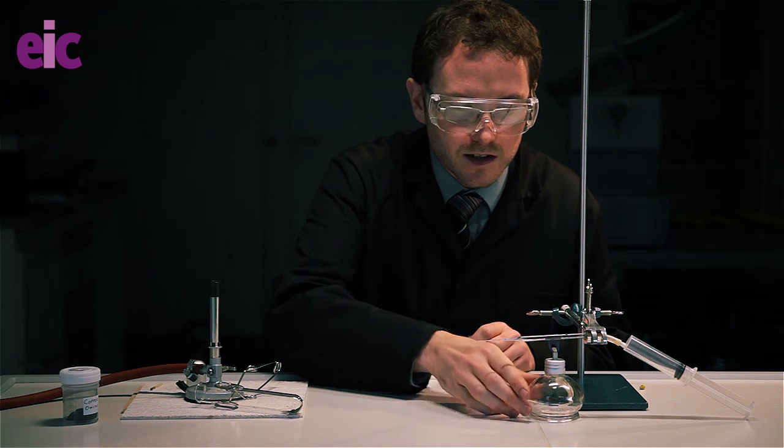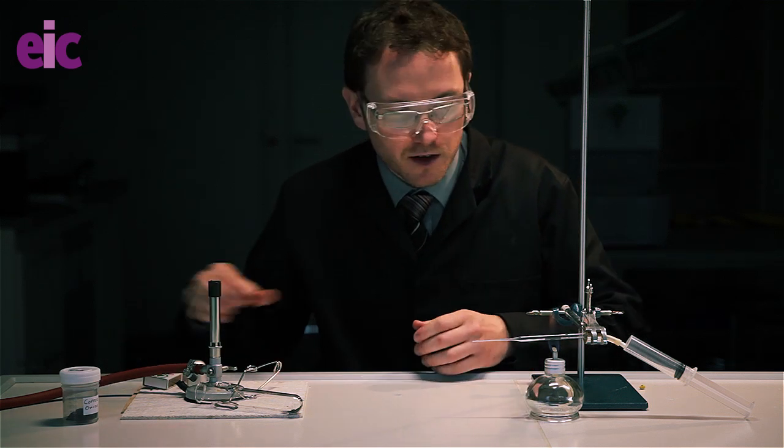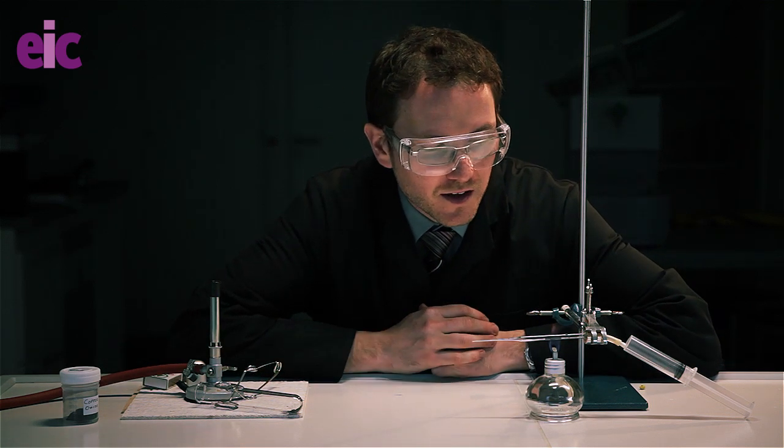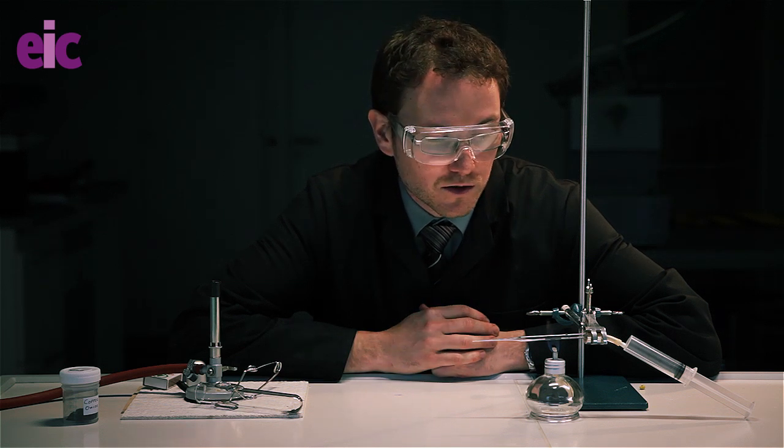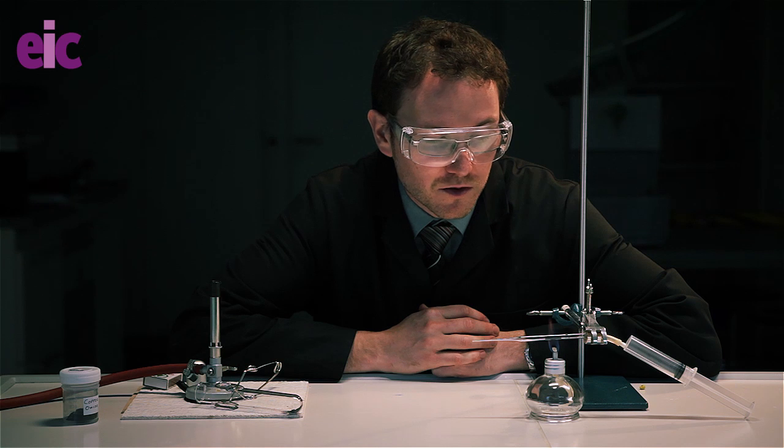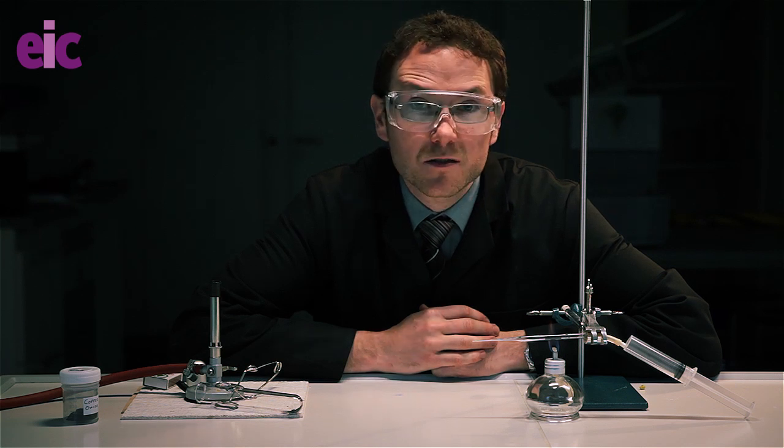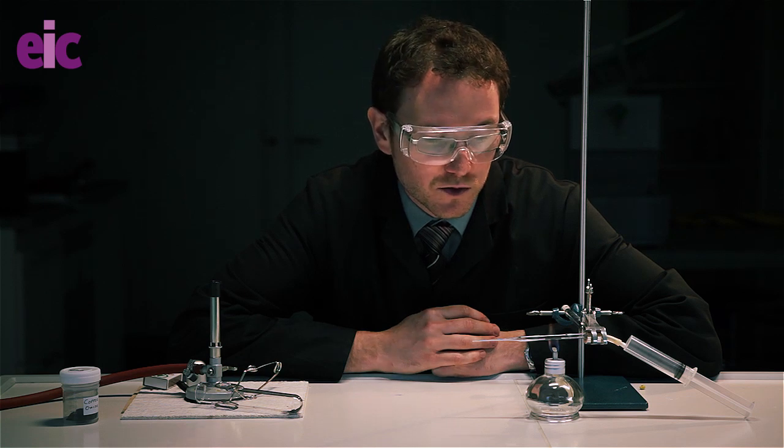If you leave that underneath the copper oxide for about two minutes, then that will get up to temperature and you'll be able to pass the hydrogen over the top of the copper oxide. So what I'll do is actually bring the camera in a little bit closer so that we can see the reaction in more detail.